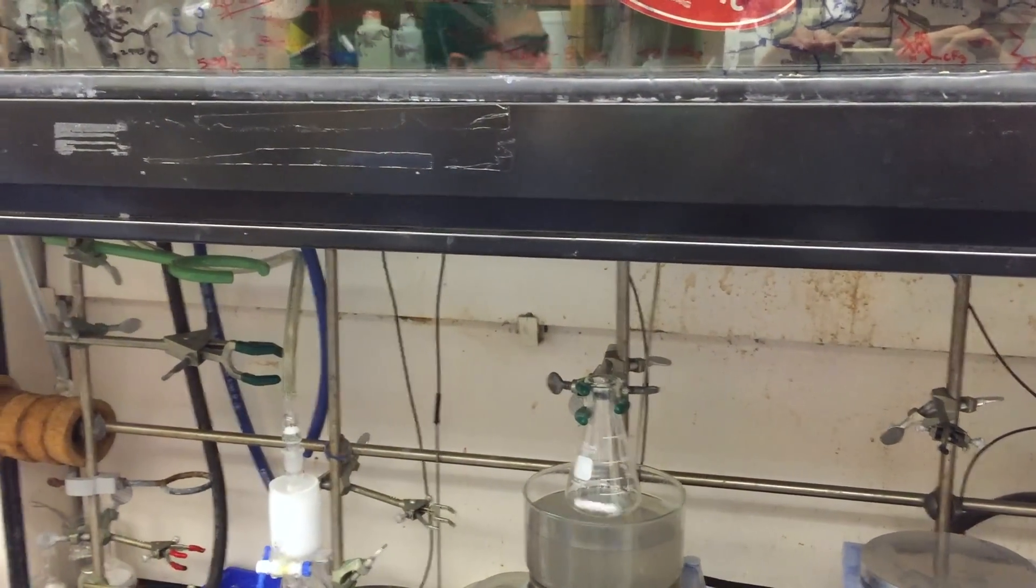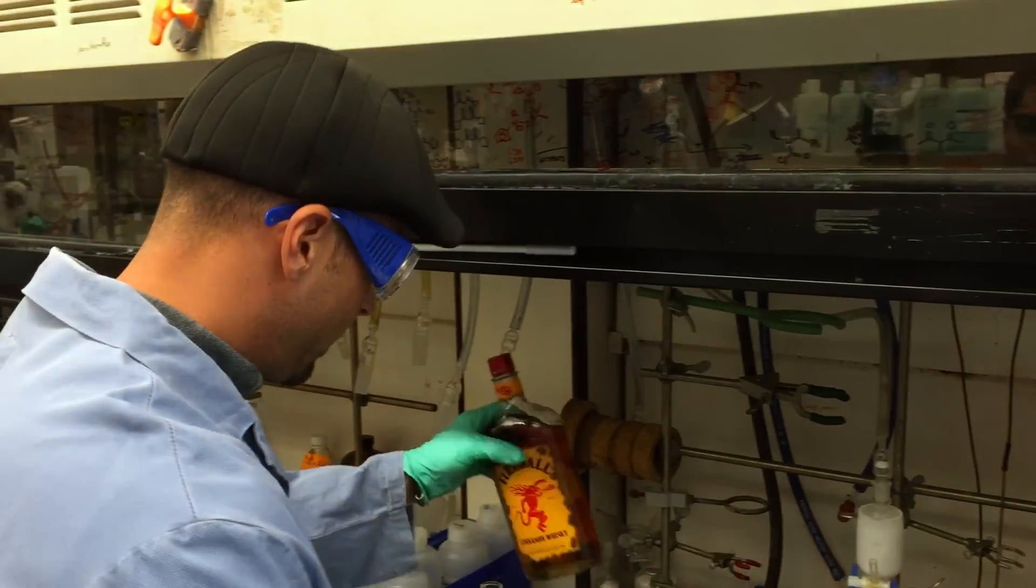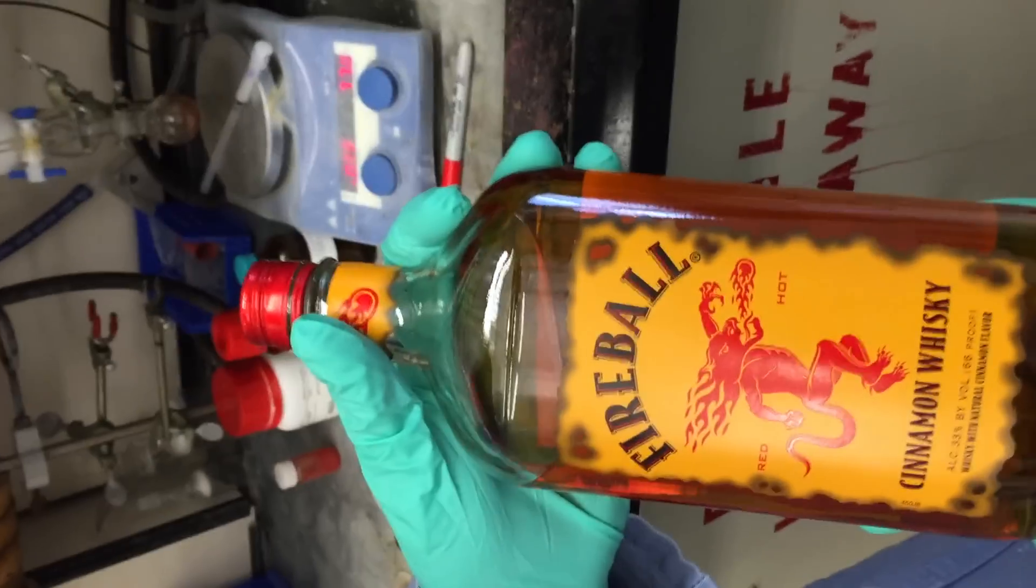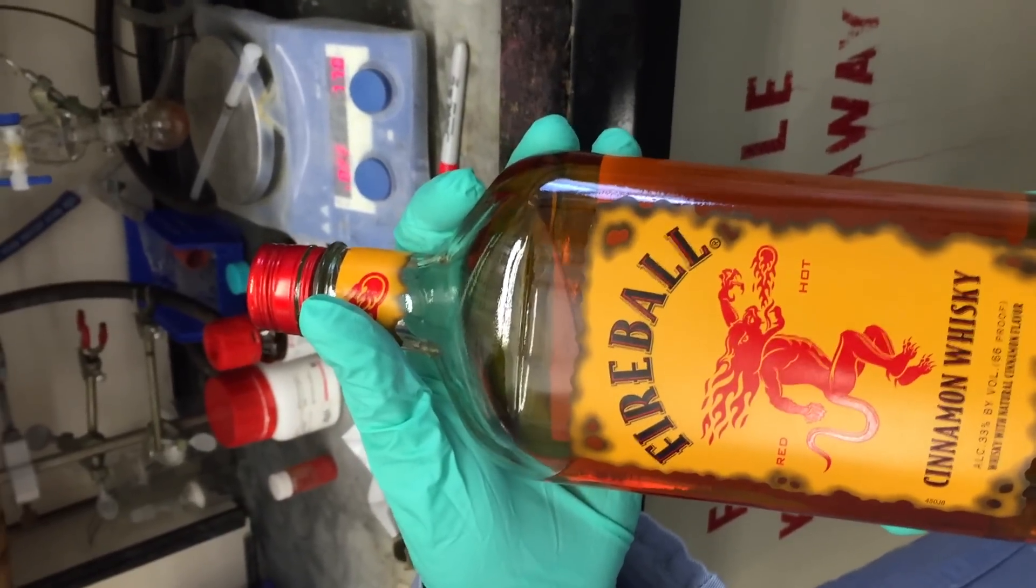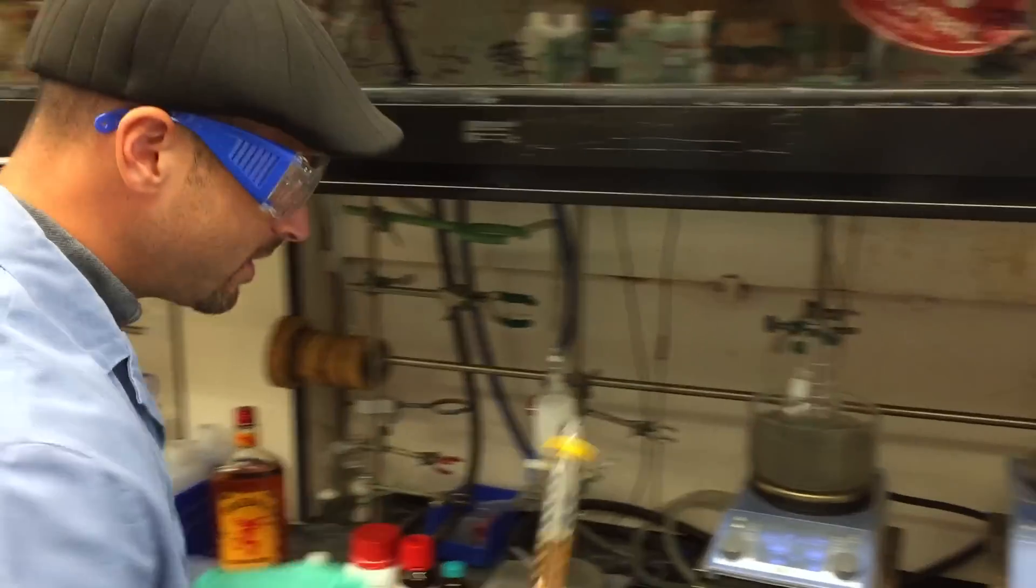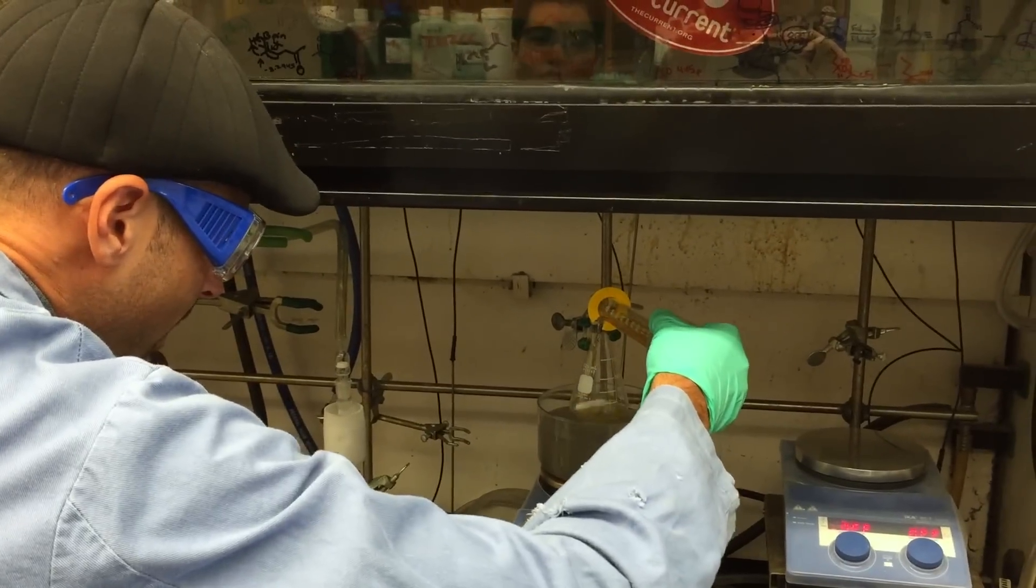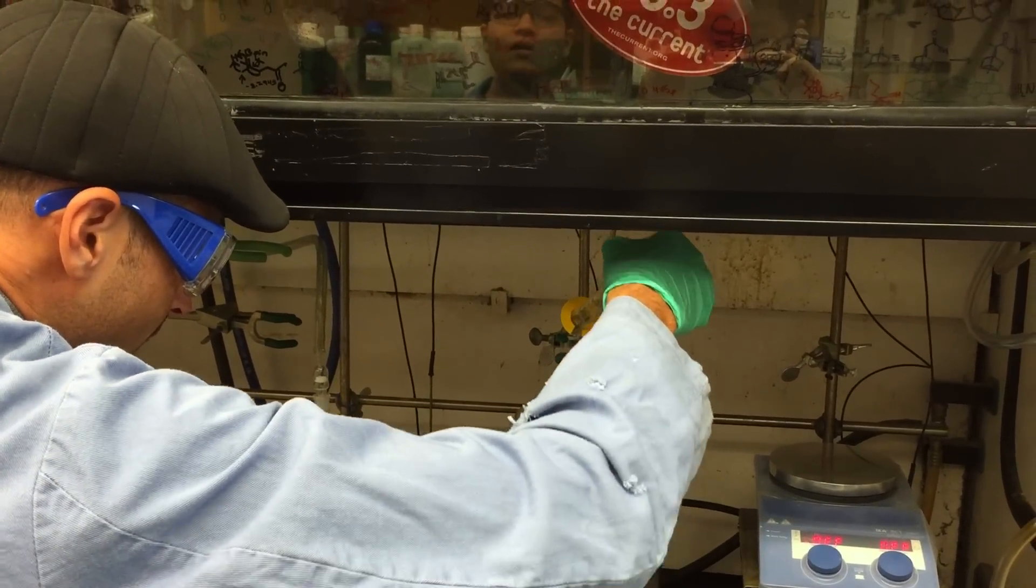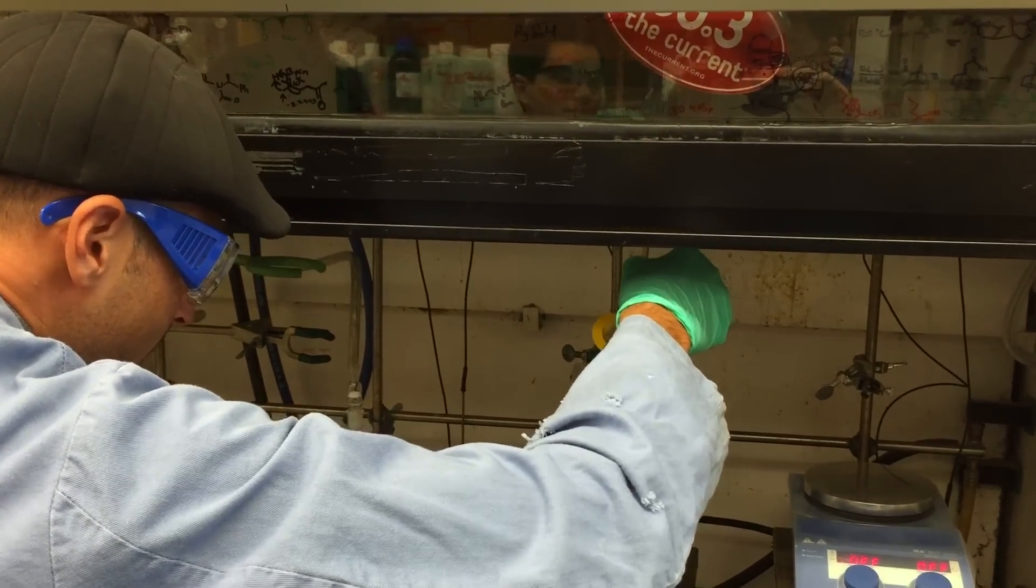It doesn't get much easier. Our solvent is a cinnamon whiskey. The students tell me they like it, particularly when the chemistry is not working. 30 mils.